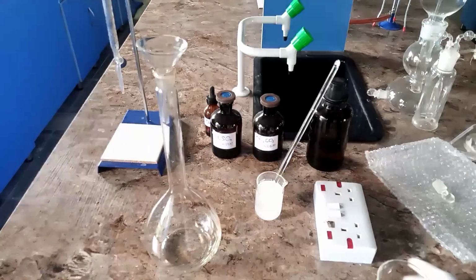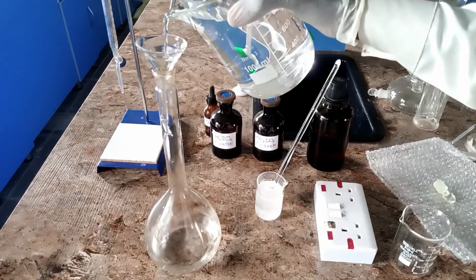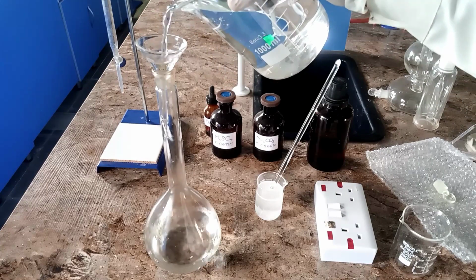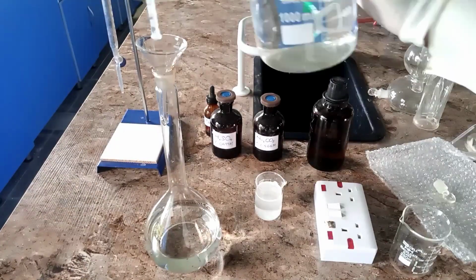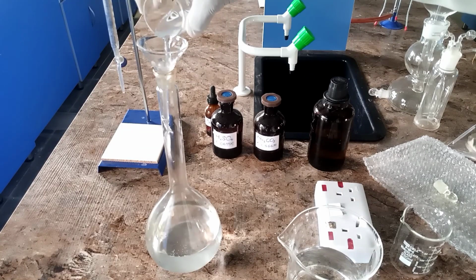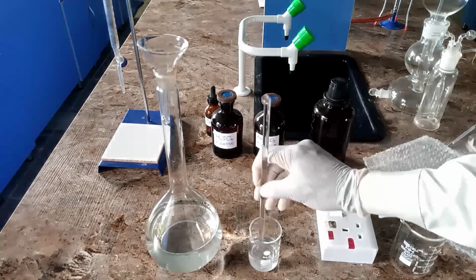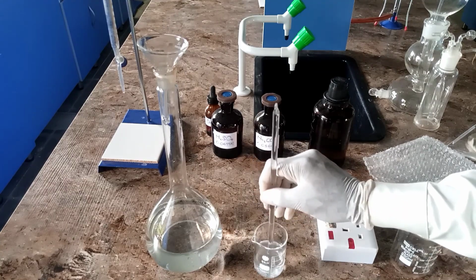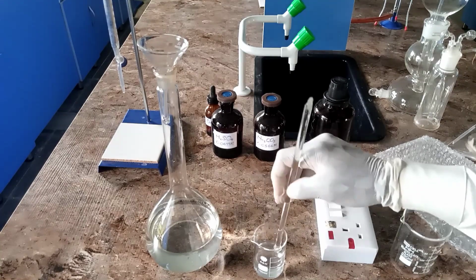After this, you add a little volume of water to your standard volumetric flask, 1000 cm cube capacity, like half of it, and then you add the sodium trioxocarbonate 4 to it. You may want to rinse it to ensure all the solid particles are well transferred into the 1000 cm cube flask.